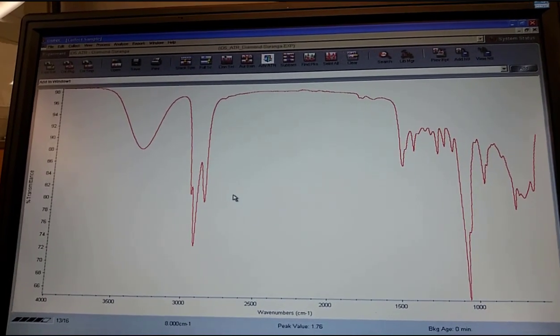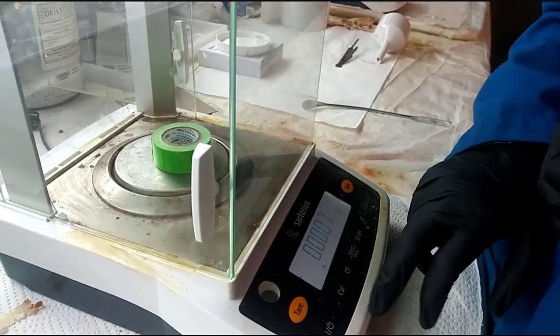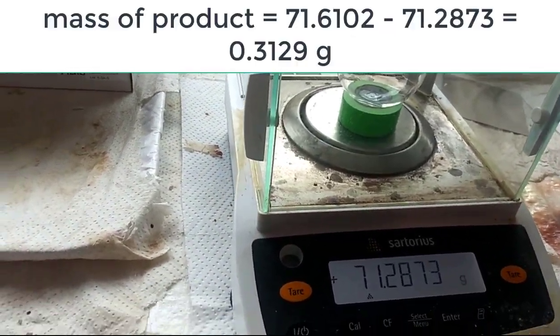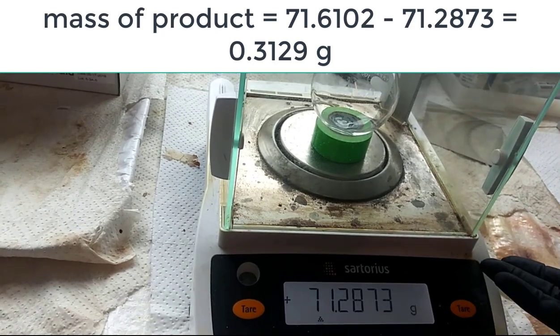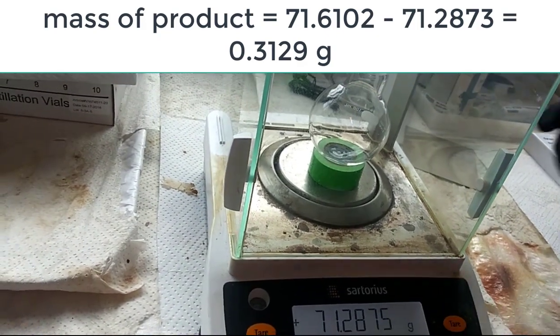And if you notice, after the 3000 range there were no sharp bands. So that alkene band, the C=C–H band, is not visible anymore. So you did convert all of your alkene to the alcohol, or you at least separated all the alkene from the alcohol, if you didn't do a 100% conversion. All right.